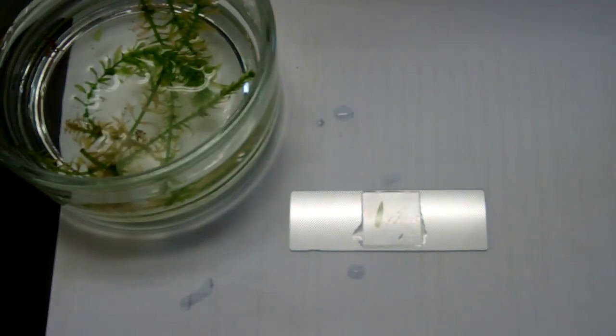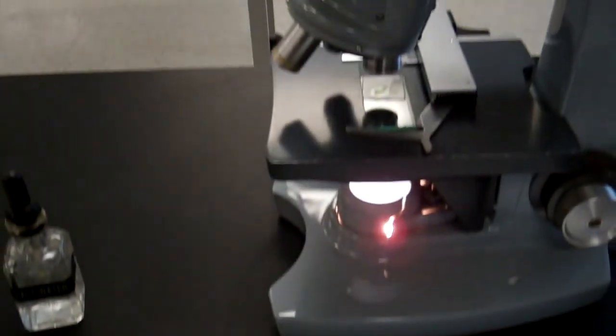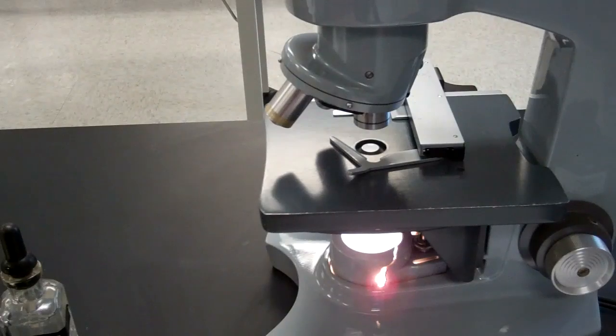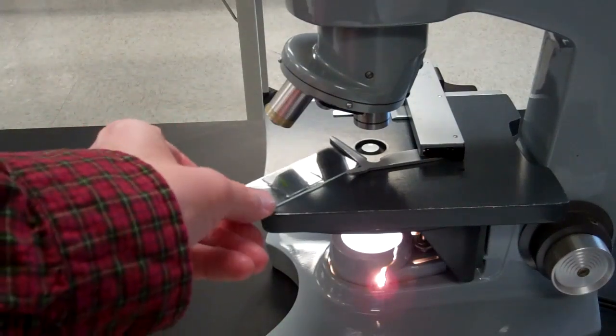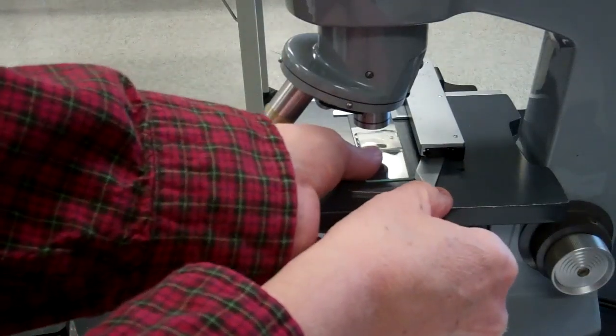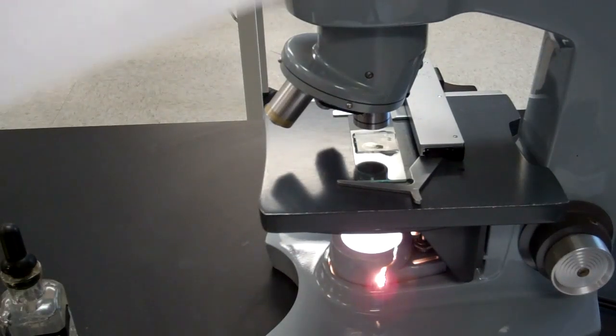And, once again, we would be putting it under the microscope. Take this one off. That's the old slide. Put the salt water slide on. And, again, we would view that under the microscope. And this time, you will see something quite different.